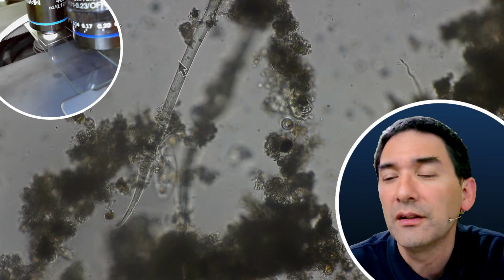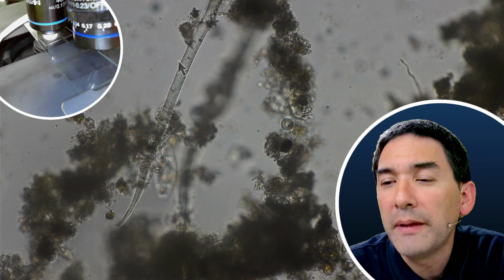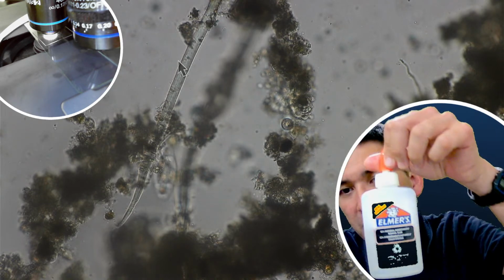Viewing dust, would you mount it using water or Elmer's? Okay, that's a good one. You know this glue.